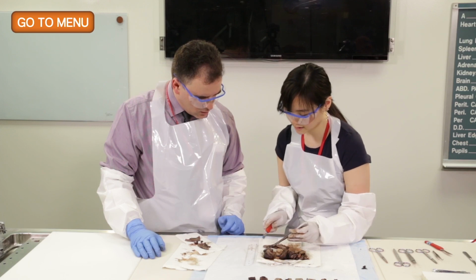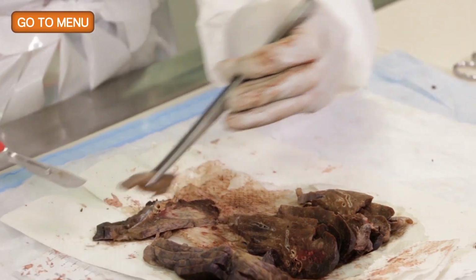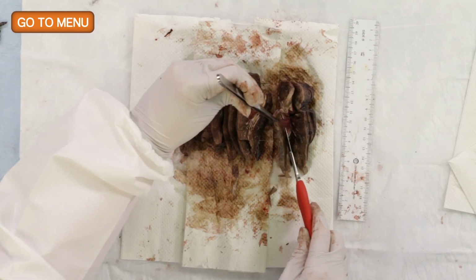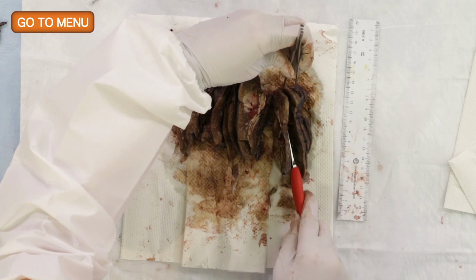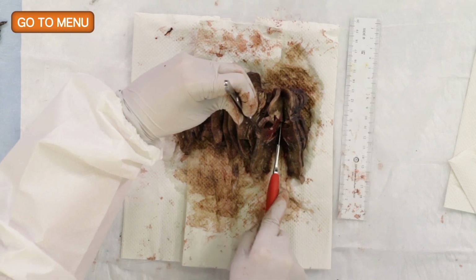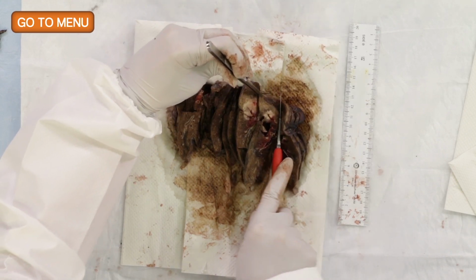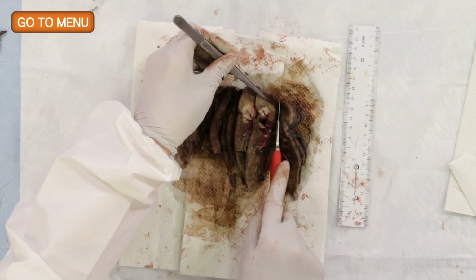Okay. And then I'm going to take a section from here. It sounds good. And perhaps we could trim this down afterwards, trim it down before we submit. I think that's a good idea. Again, it just makes it easier for the tissue to fix. There are other reasons. It will help histology to cut the sections, but also as we think about immunohistochemistry and other ancillary tests that we may need to do, uniform fixation of the specimen is an important parameter for the success of those tests, as it probably is for the success of molecular tests. So we have to be thoughtful about not underfixing or overfixing the specimen.